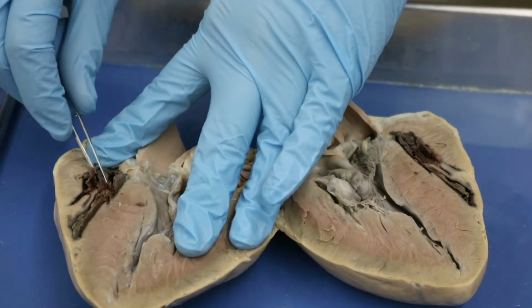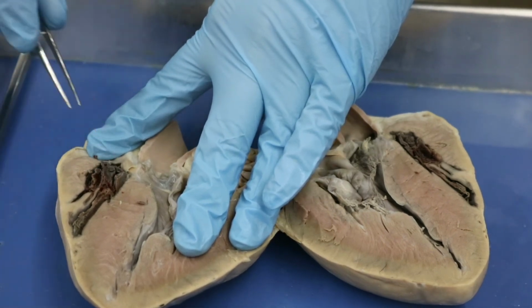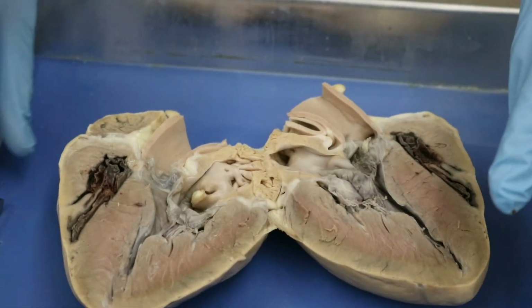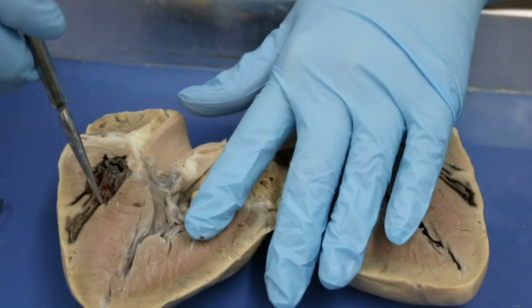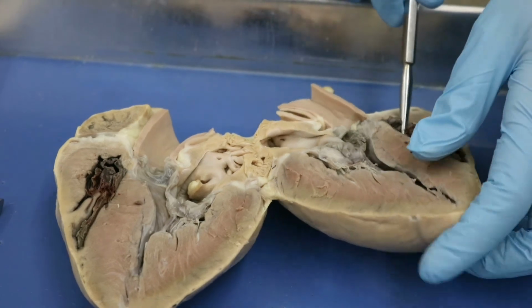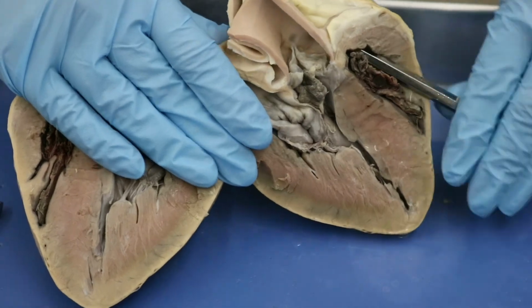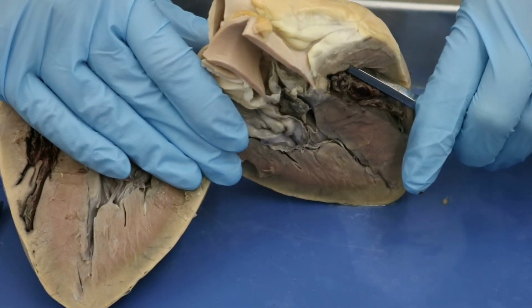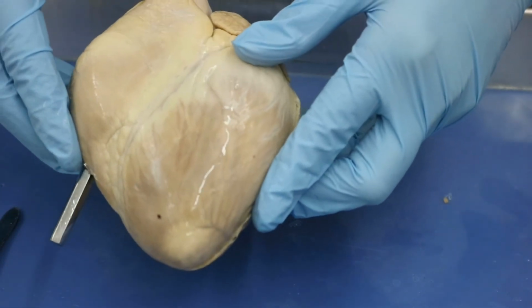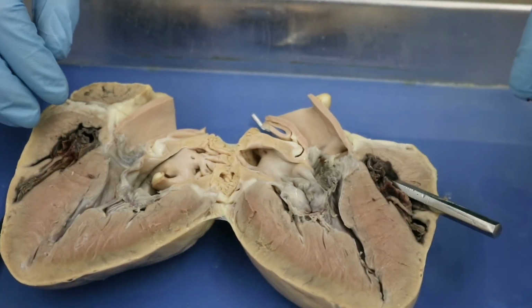So here's our tricuspid valve right here, okay? And so the tricuspid valve, of course, is the opening between the atrium and the ventricle down below, okay? And let's see, can we find, I'm not sure we're going to be able to on this heart. Oh, there it is. Okay. And our probe is going through and it is coming out here, which is, of course, when we close it back up, what we identified previously as our pulmonary trunk, okay, coming out of the right ventricle.